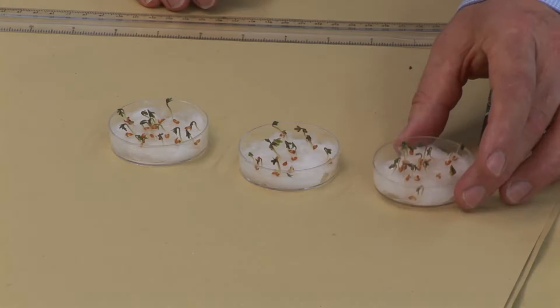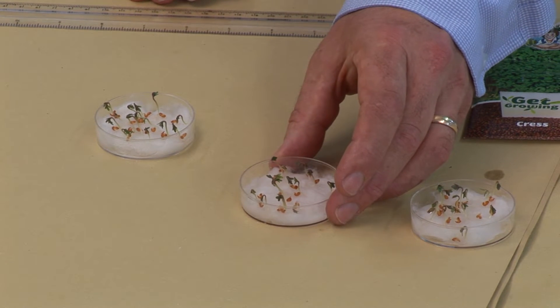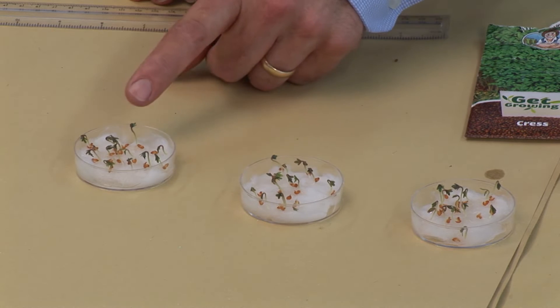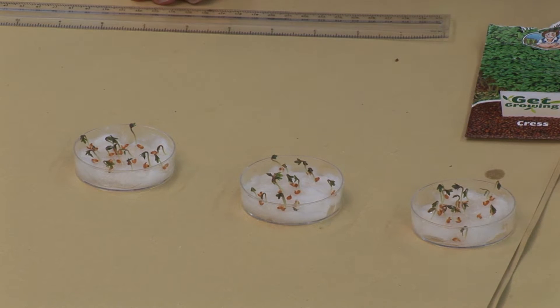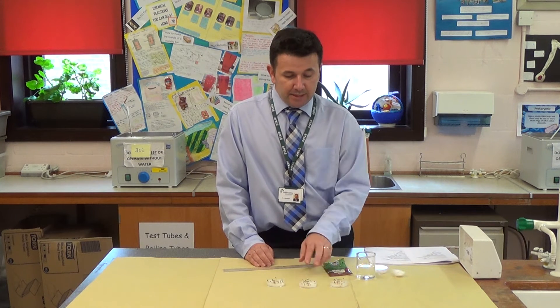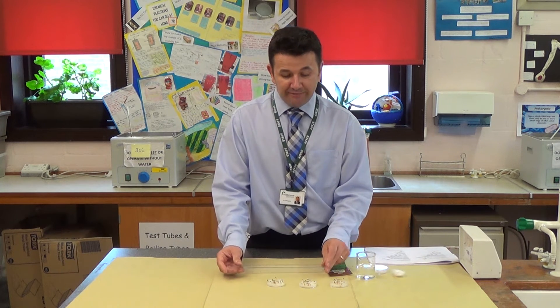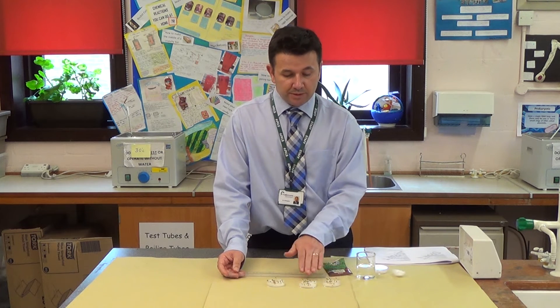I'm going to change the light intensity across the three dishes. The first one I'll put on a windowsill with lots of light. The second one will have partial light, probably in the classroom away from the window. The third one I'll stick in a cupboard periodically — in the cupboard for a day, then partial light for a day, then back in the cupboard. My dependent variable is measuring the length of the cress seed using a ruler, and I'll do that over seven days.